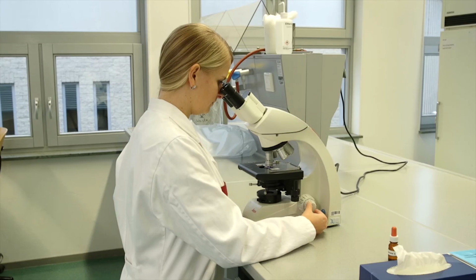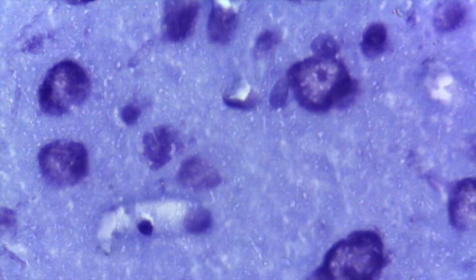If the image was sharp with the 40 times objective, then there will only be very minimal adjustment needed. Importantly, if you can't get the image in focus with just small movements of the fine focus knob, then start again. For this, the immersion oil must be cleaned off the slide first so that other objectives don't get dirty.